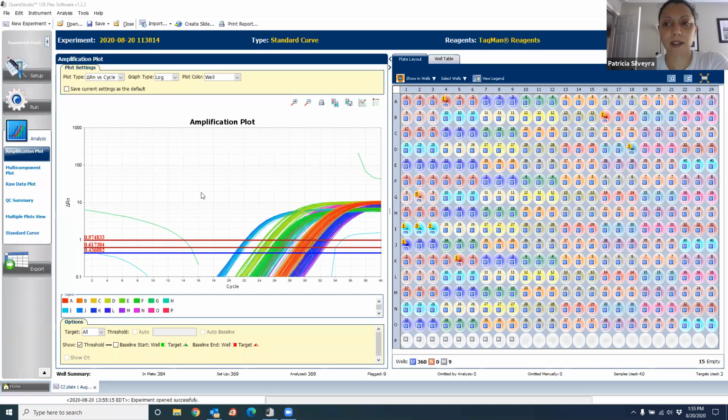All right, so let me show you how to analyze the plate. So you just send me this file and I haven't touched anything, so that you just identify what you sent to me. And what you can see here is that there are a lot of things that show background, right? So there's several ways of getting rid of that bad background.